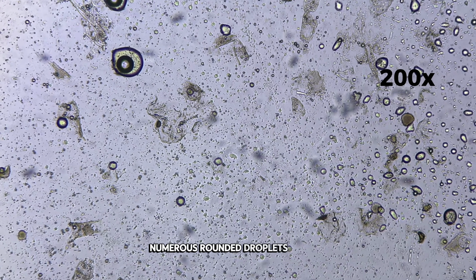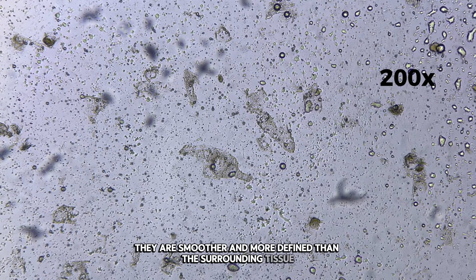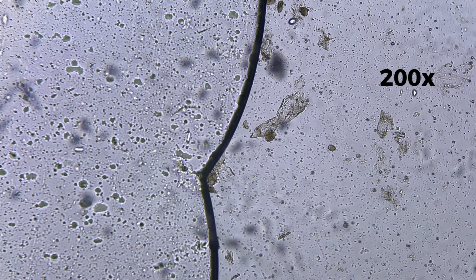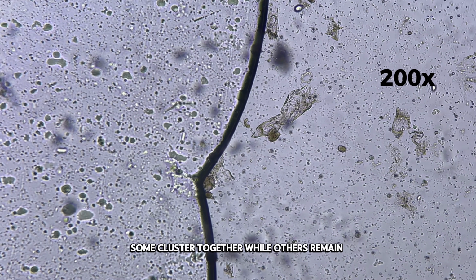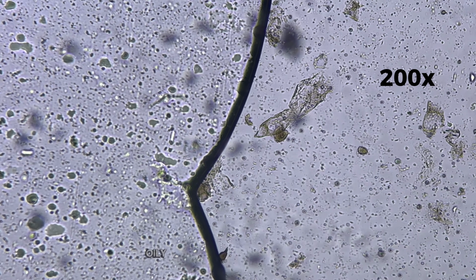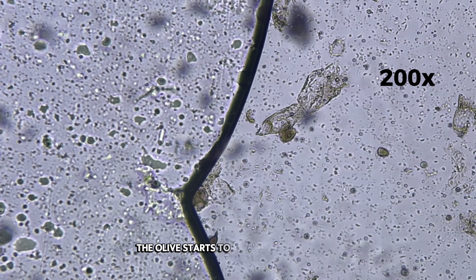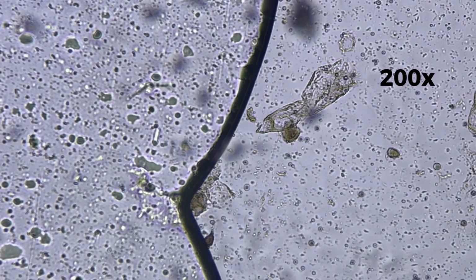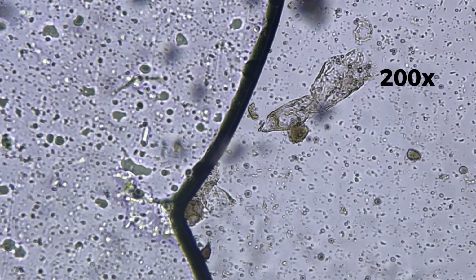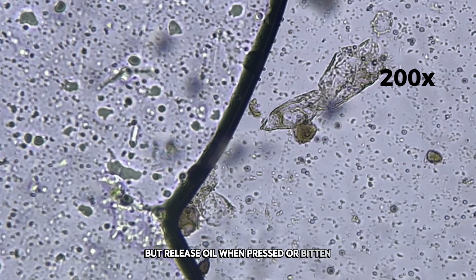Numerous rounded droplets appear throughout the image. They are smoother and more defined than the surrounding tissue. These droplets vary in size and are unevenly distributed. Some cluster together while others remain isolated. The contrast between dense plant material and smoother oily regions becomes very noticeable. At this scale, the olive starts to look like a carefully balanced system. A system where solid structure and liquid components coexist tightly. This level helps explain why olives feel firm but release oil when pressed or bitten.